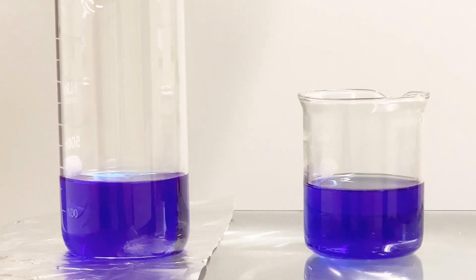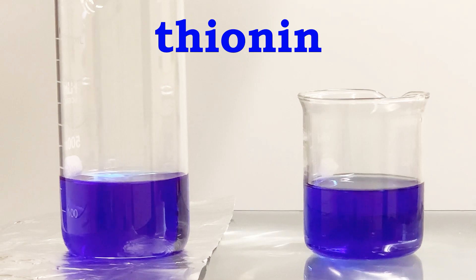These two beakers contain a mixture of iron ions and a blue dye called thionine. Watch what happens when we shine light through the beaker on the right.